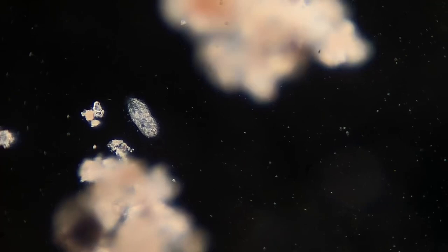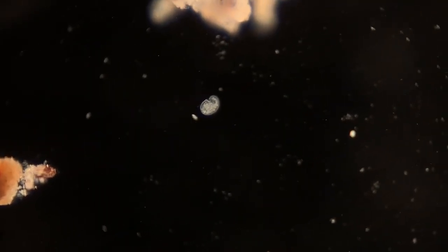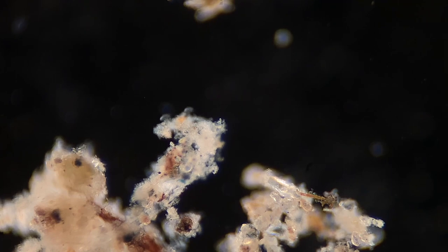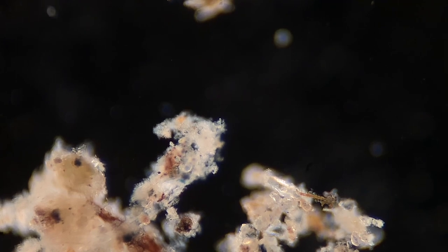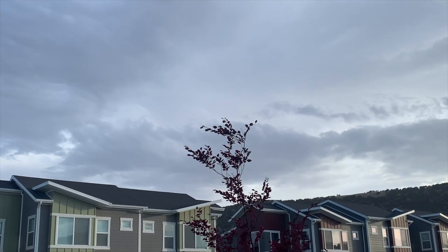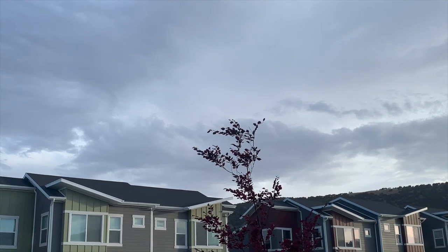Every microorganism that you're about to see in this video came from rainwater. Welcome everyone to Fantastic Microbes and Where to Find Them. If this is your first time, my name is Jordan, and I like to travel around collecting microbes from all over the place.